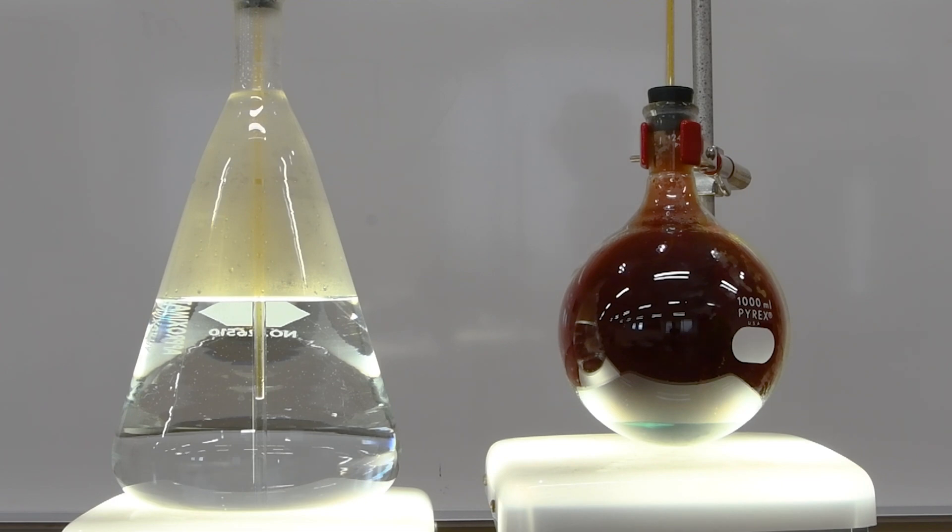The nitrogen dioxide now in the right-hand flask is beginning to cool, and as it does, it's contracting, and the pressure is dropping. You can see the water rising up the glass tube in the left-hand flask due to that decrease in pressure.